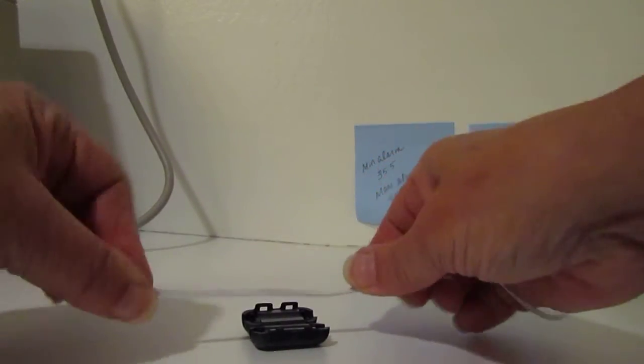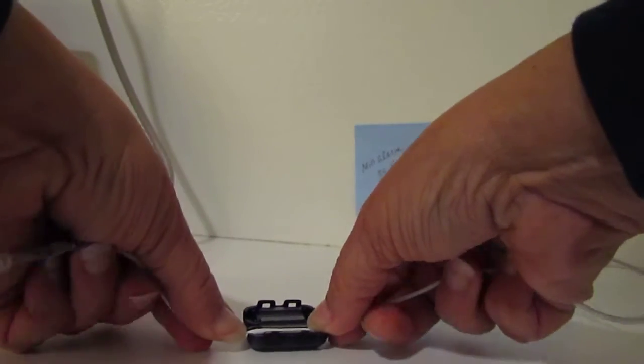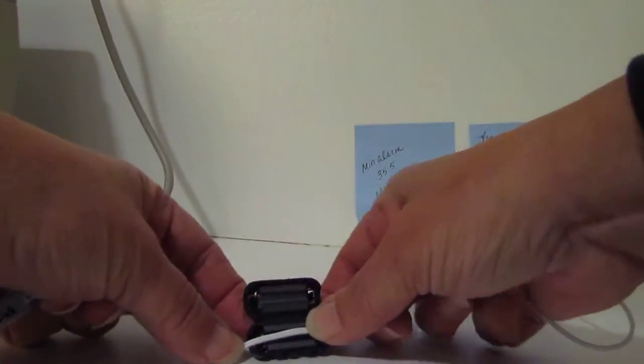You're going to lay the cord in here, into the thing here. There's a little groove there.